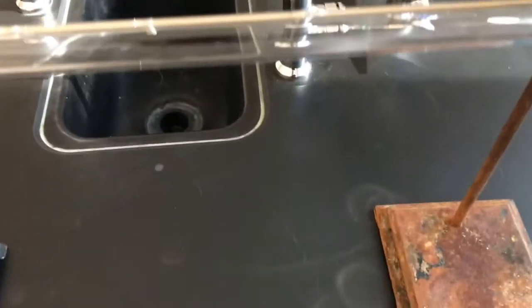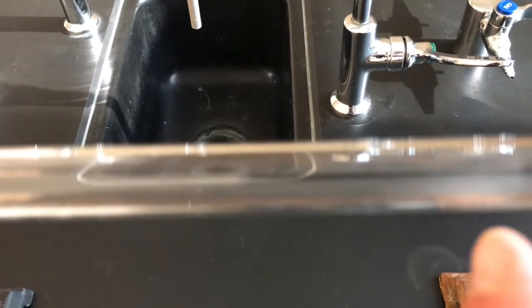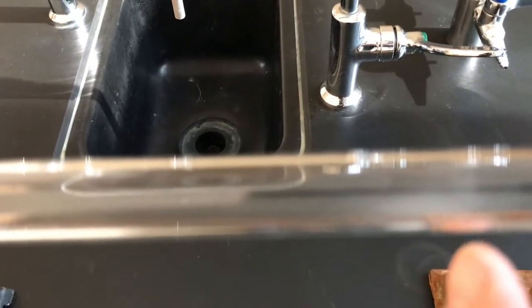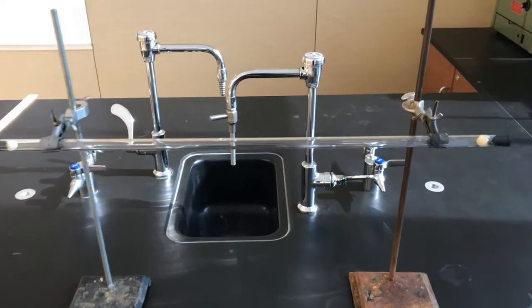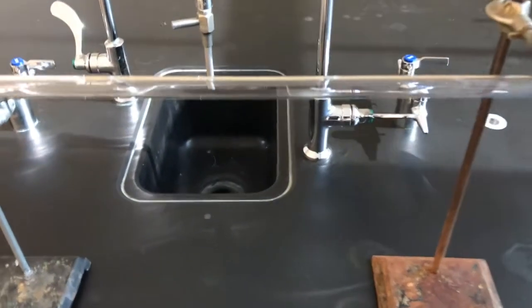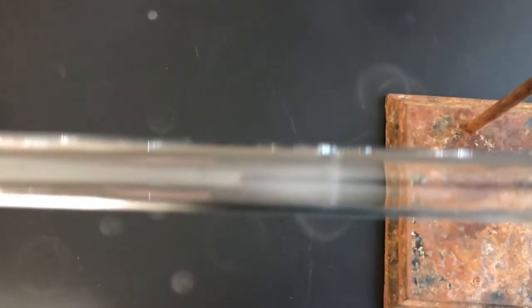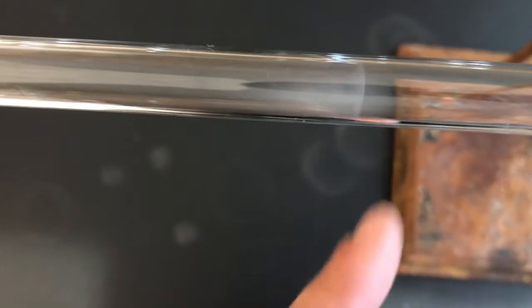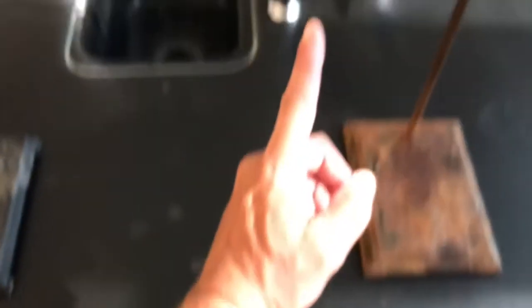We see the white ring. Let me get a good background here. It's right there. So again, we have this glass tube that raced ammonia and hydrochloric acid vapor, and right there is the ammonium chloride.